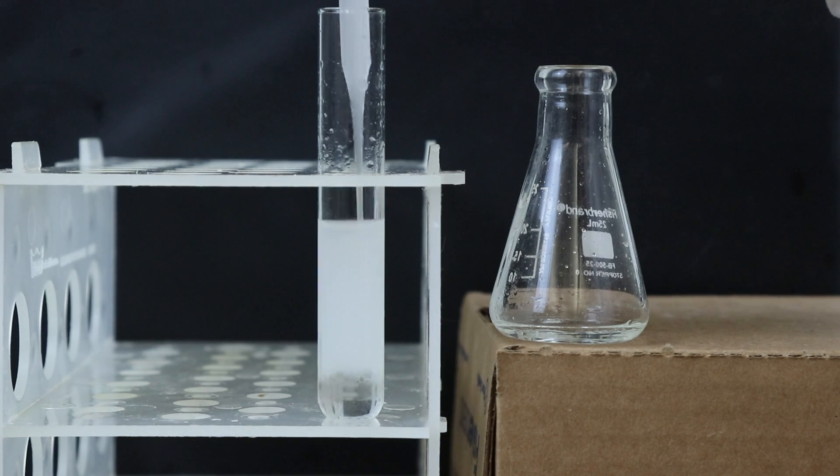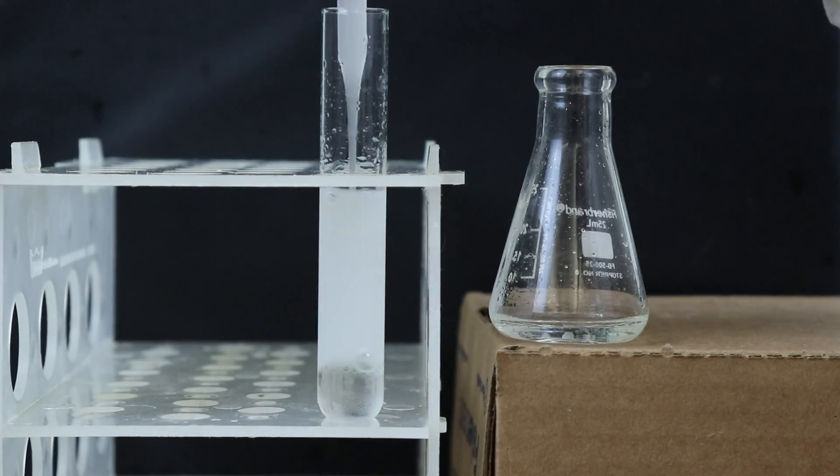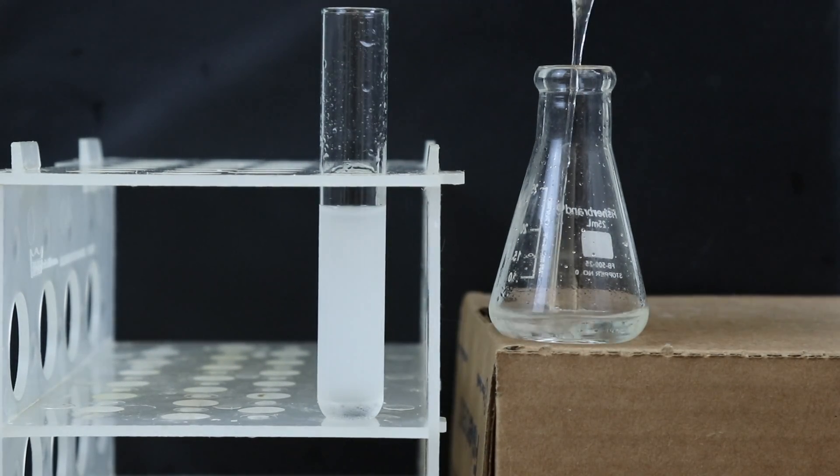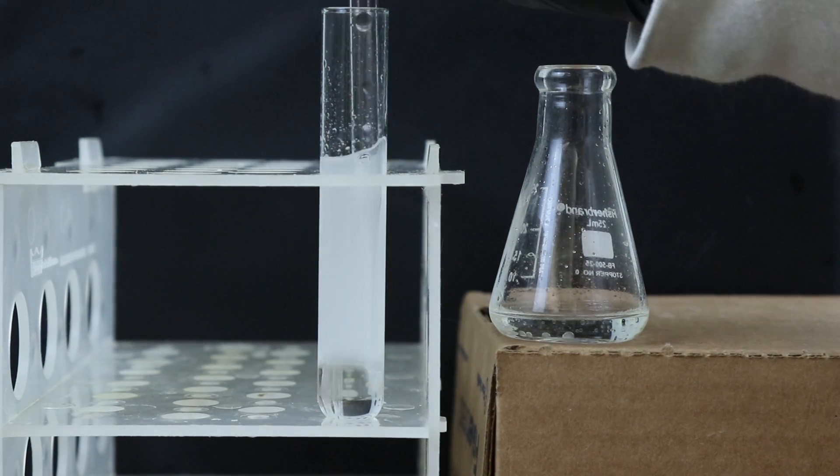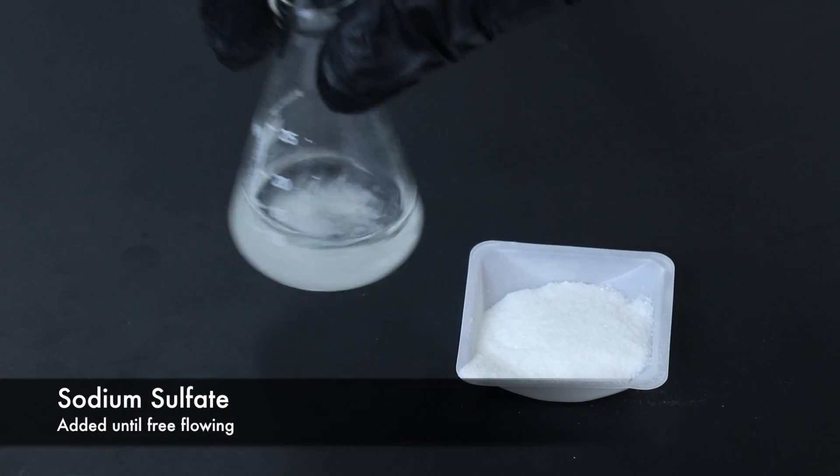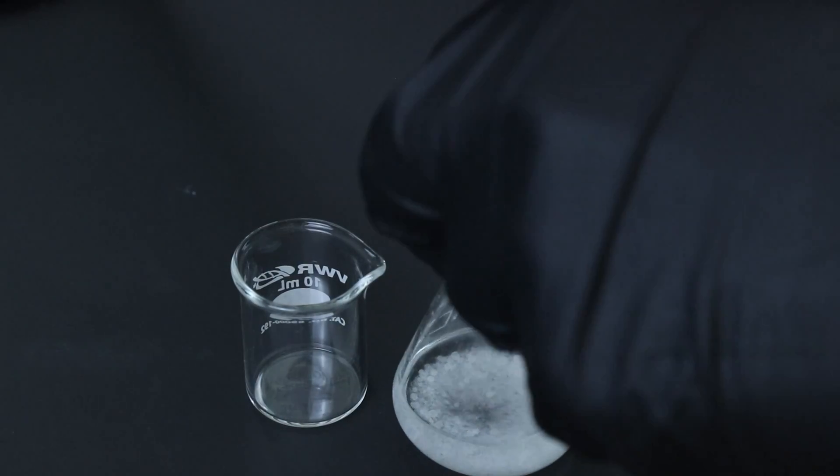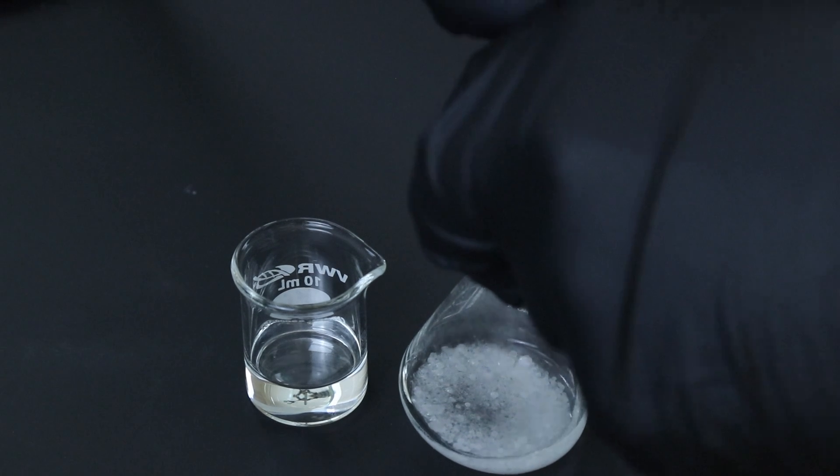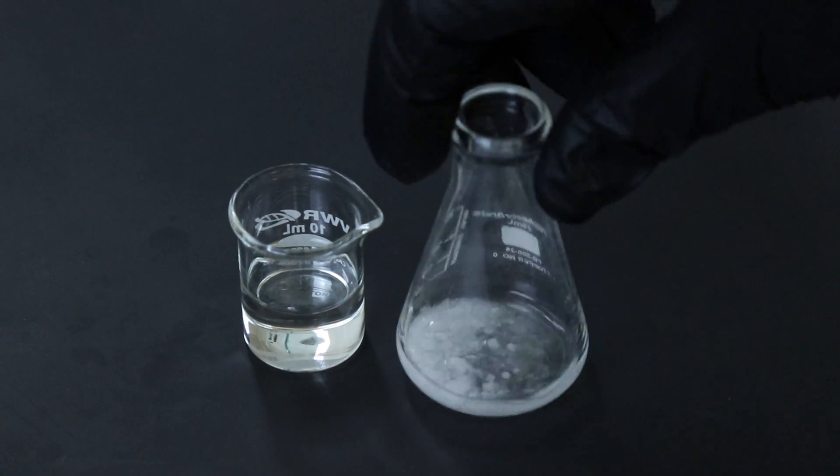Now I'll continue with the extractions, adding methylene chloride, mixing the two phases, and transferring the organic layer to the Erlenmeyer flask and I'll do this a total of three times. Once the extracts have been gathered I'll dry that organic phase over some sodium sulfate and I'll add that until it's free flowing. Then I'll transfer that solution over to a beaker and since I used quite a bit of methylene chloride I'm transferring it to a beaker rather than a conical vial although a conical vial would probably be preferred. And I'll rinse the sodium sulfate with some additional methylene chloride to help reclaim more product.